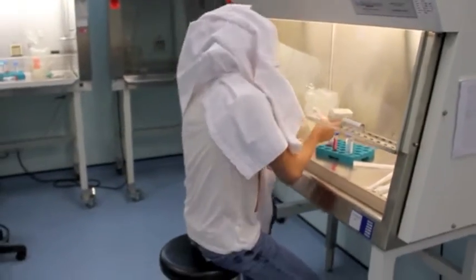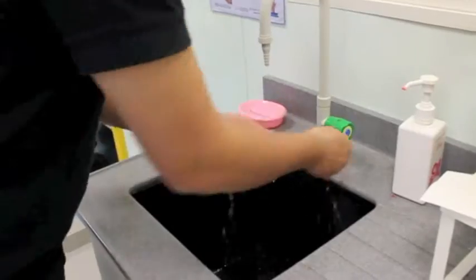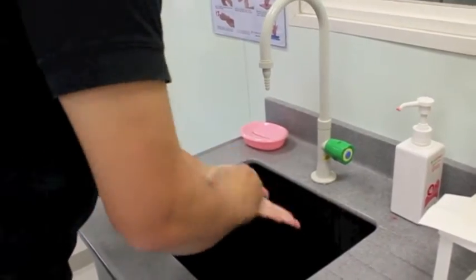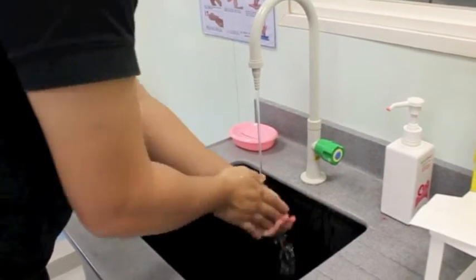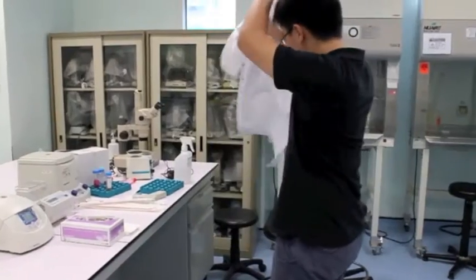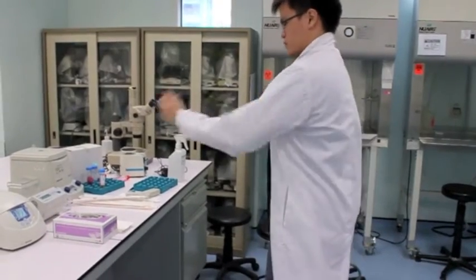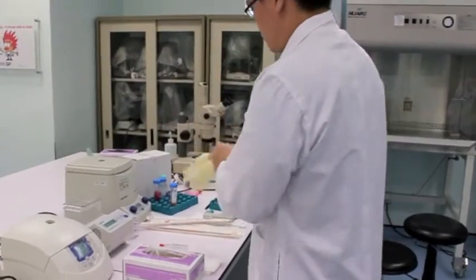And you have to put on the appropriate PPE, which includes a lab coat as well as a pair of latex gloves. Before performing cell culture, you must ensure that you wash your hands thoroughly. And as mentioned earlier, you require the appropriate PPE, a lab coat, as well as a pair of latex gloves.